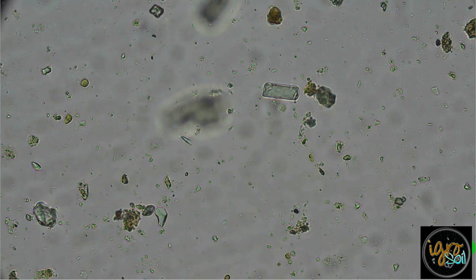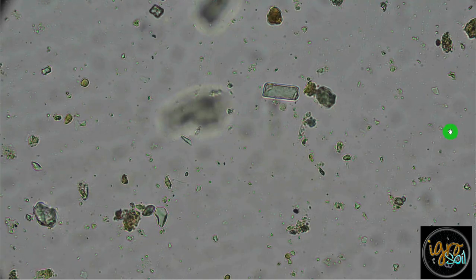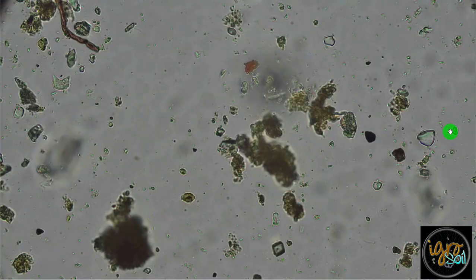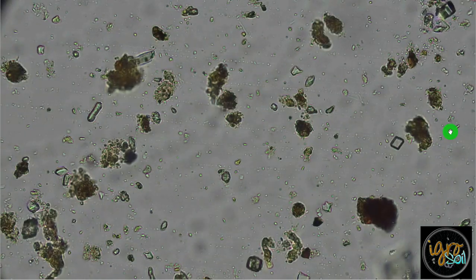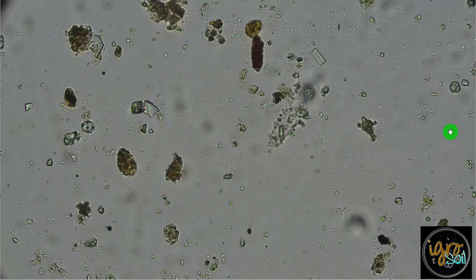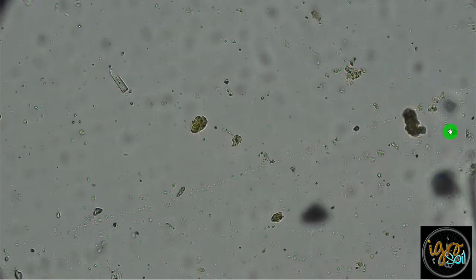And then all these little shards of glass that you're looking at, that's all sand, maybe minerals, but for the most part, it's usually sand in our region. Plus, I'm looking at a pretty decent sized bag of soil, and it makes sense. You have really no life in here as far as predatorial life. And without predatorial life, the nutrient cycle comes to a halt.